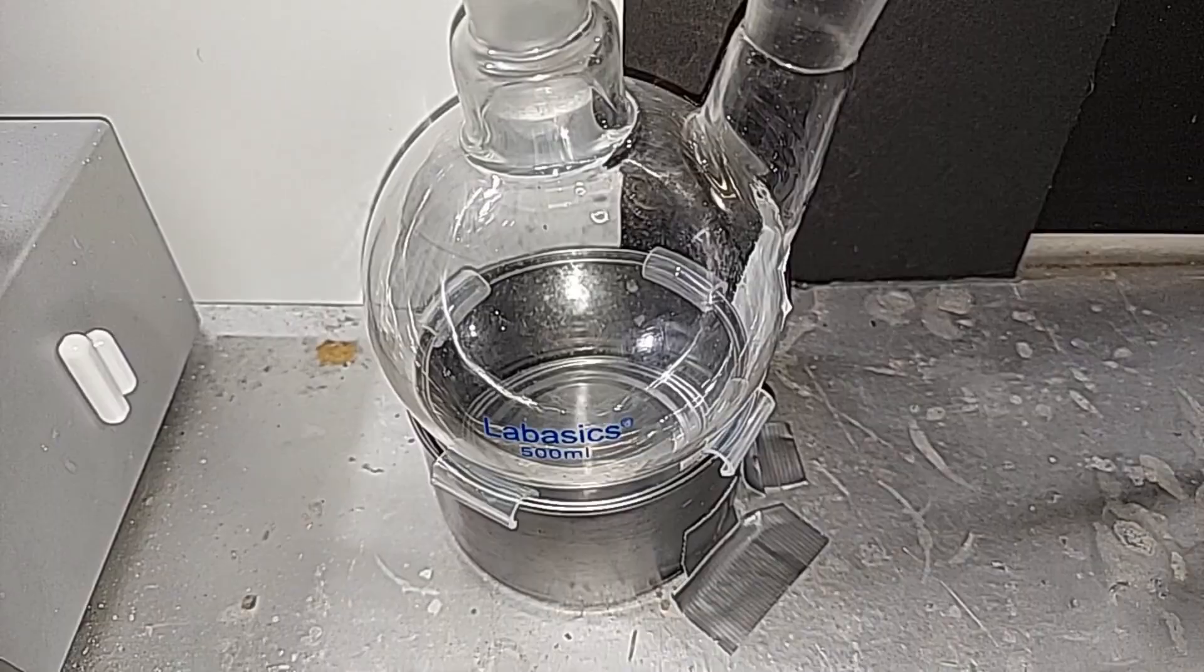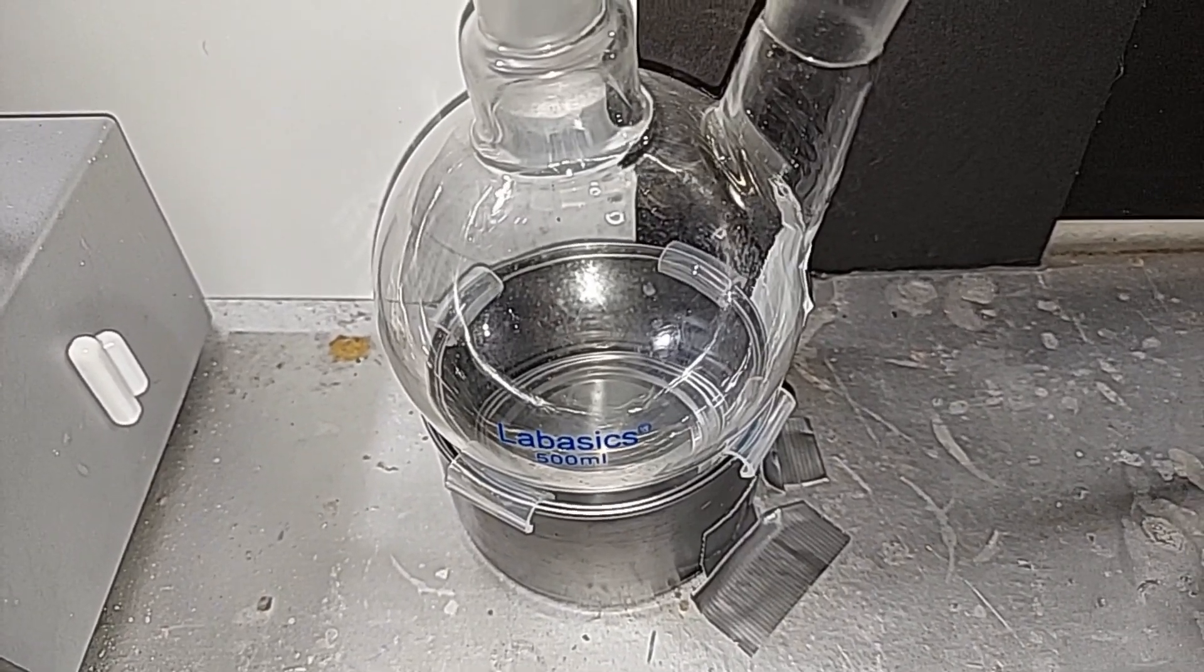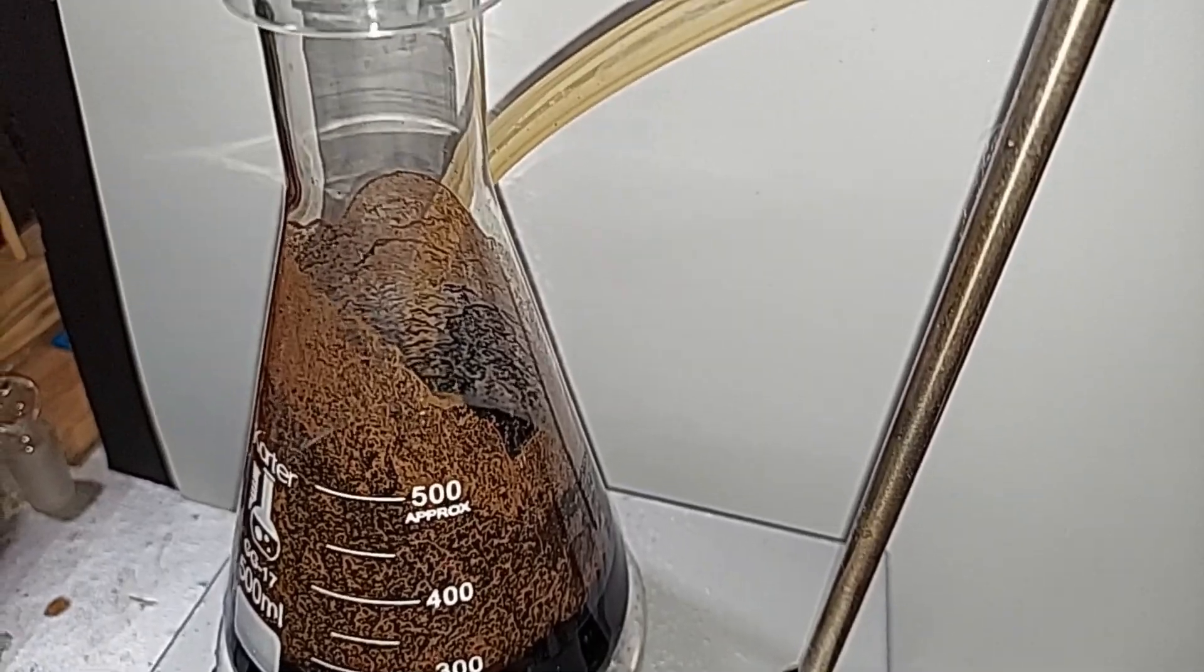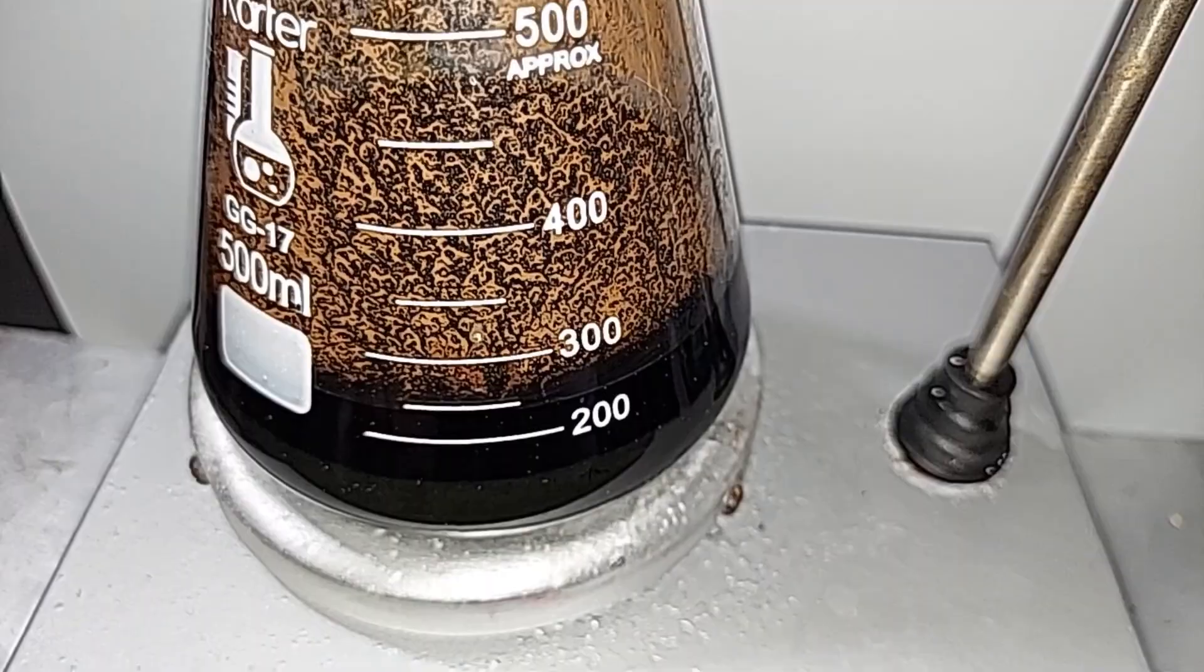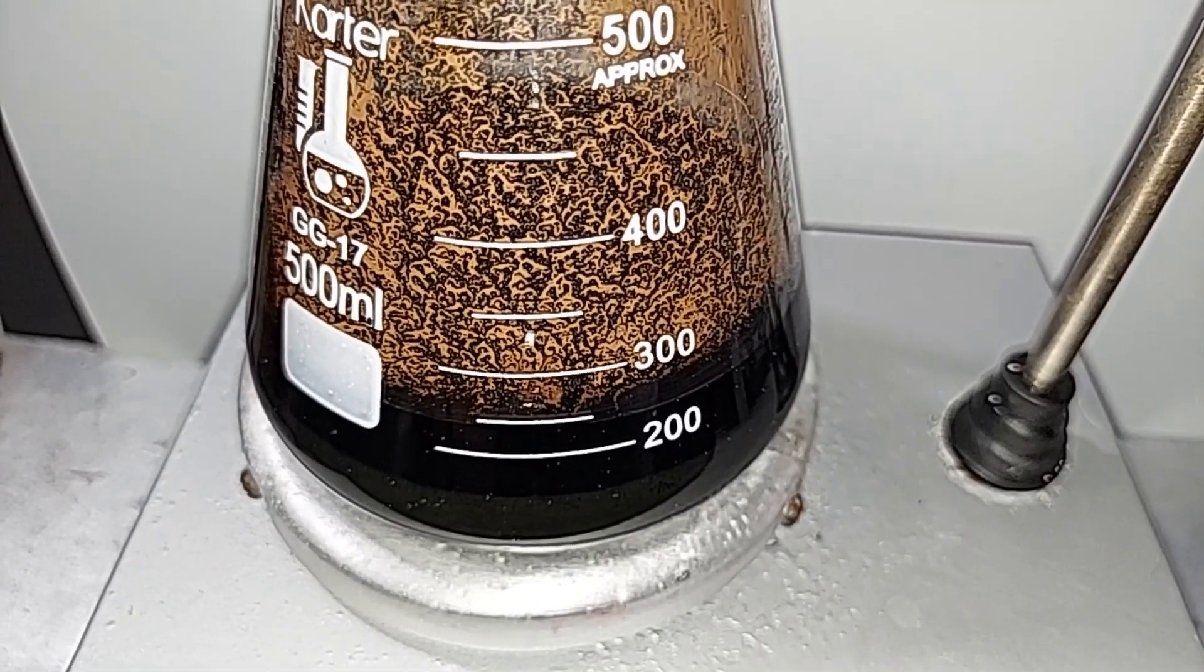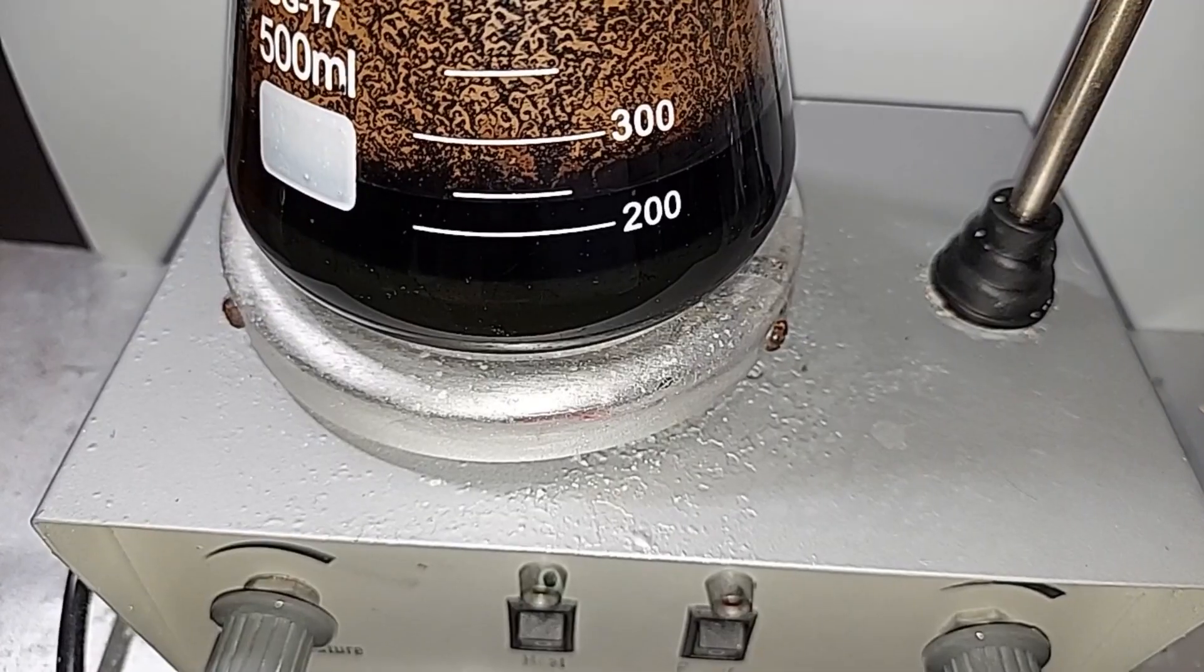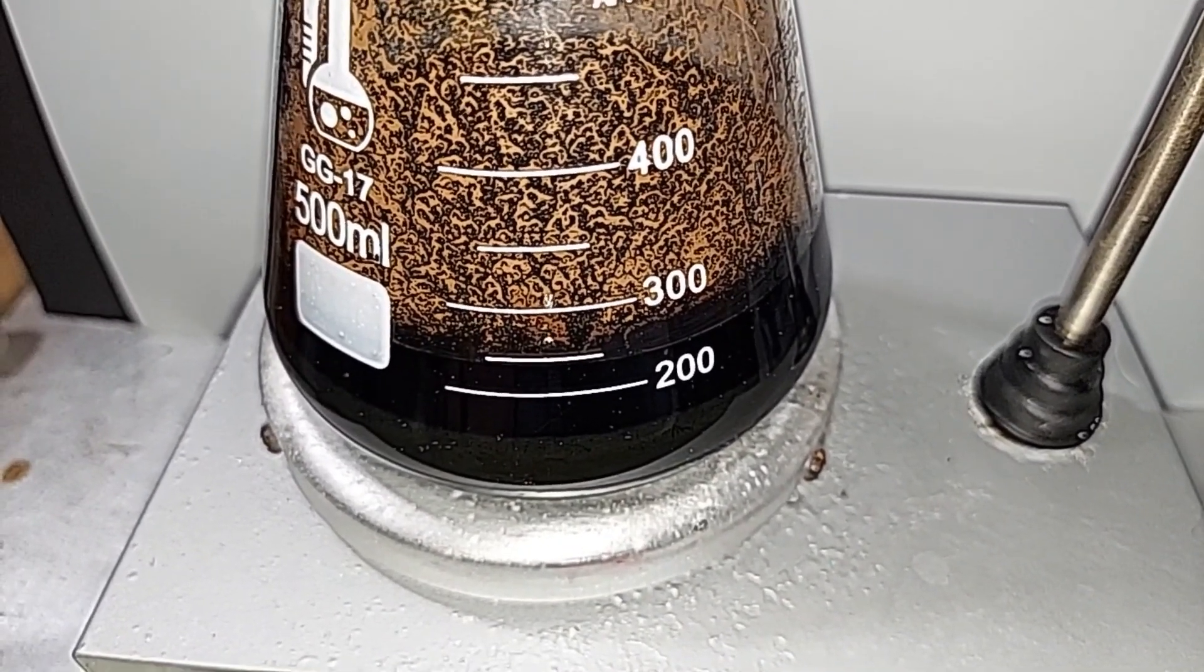It looks like that because when I was finished mixing, I swirled it around by hand and got the stuff all the way up the flask. Having this backflow catcher might be overkill, but if you've ever had an accidental backflow, it ruins the experiment. At least twice it's really come in handy. I'm going to put the tube for the chlorine gas into the potassium manganate solution. Because chlorine oxidizes the manganate better in slightly warmer temperatures, I'm going to turn the heat up very low, maybe 30 degrees Celsius.